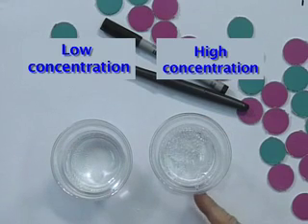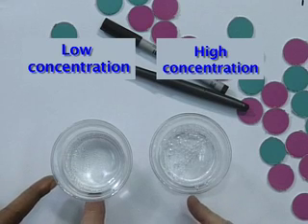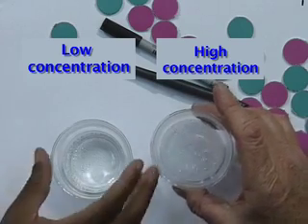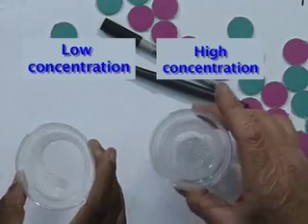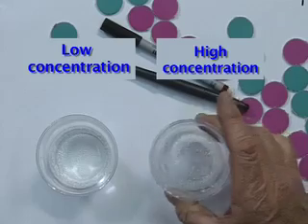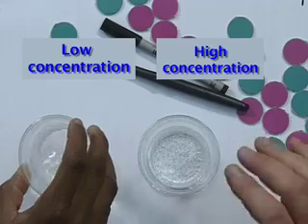Could you see what happened there? That has completely reacted, whereas this is still reacting quite slowly. Let me try and swirl mine. Maybe it can be faster. It really doesn't make much difference, but this is making a very fruit salty kind of sound as we swirl it around, because the higher concentration means that for the same amount of vinegar, we're getting far more successful collisions and hence reactions in this container as opposed to that one.